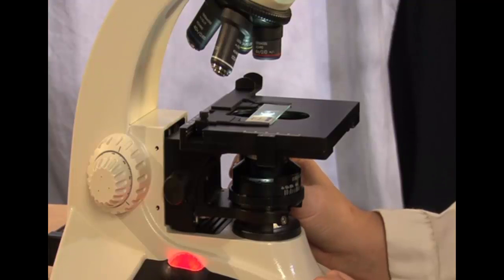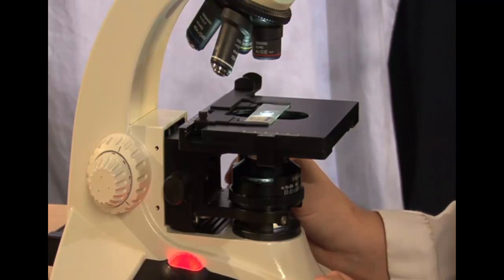At this point, move the slide so that your specimen is in line between the lens and the condenser. Now that we have the slide in place, we can begin to focus on the specimen.